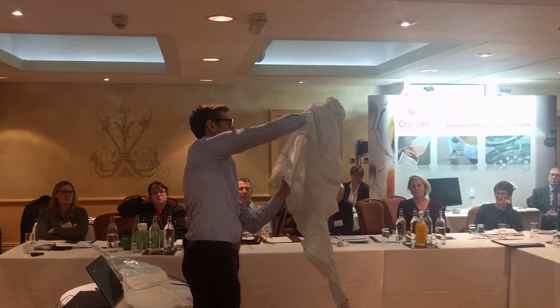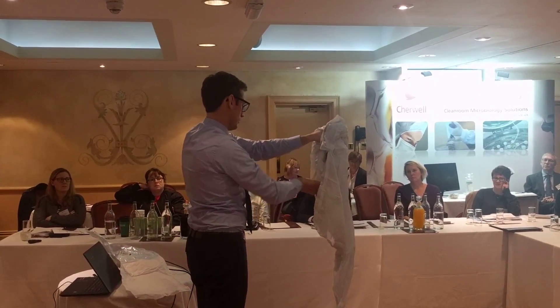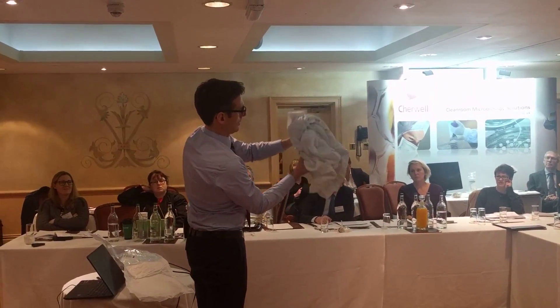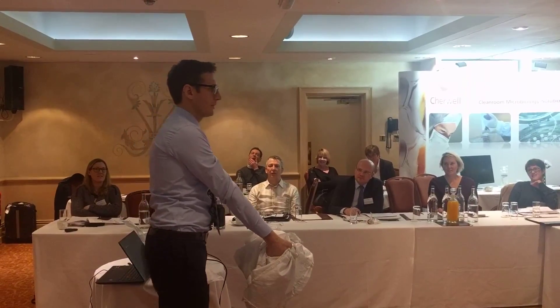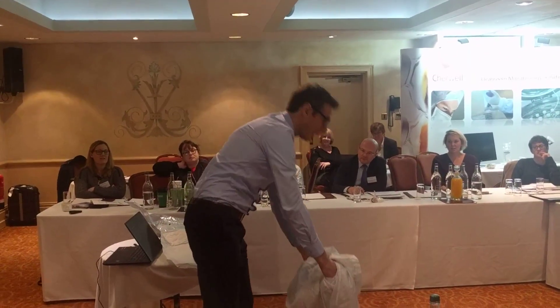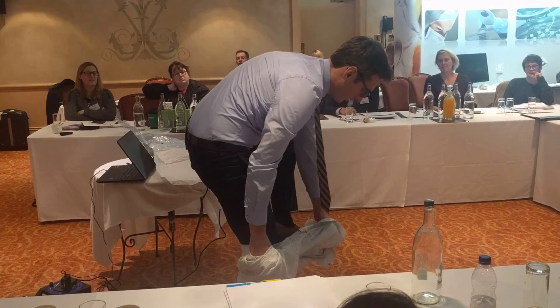Grab the left arm and collect all the material here. Take it in my left leg and grab the right sleeve. The advantage is that it's quite compact and I'm only touching it on the inside. Now this is a critical step for the aseptic donning — to protect my thumbs from contaminating it when I step into the overall. I did some yoga this morning to stay flexible. And then I step into the overall.